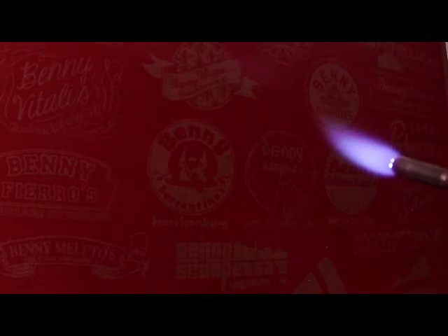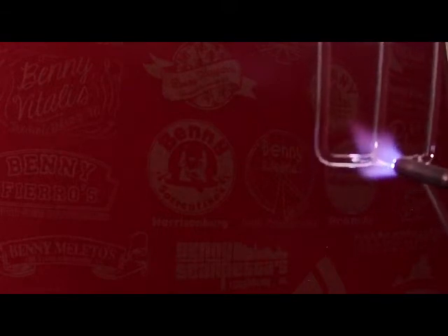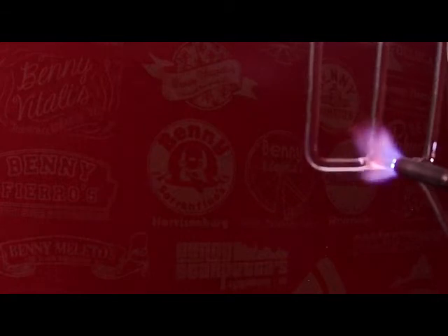In other words, if your goal is to have your piece of glass perfectly measured and fit the top and the bottom exactly on the inside of this little square, and then tack weld both of them, good luck to you, because that's going to be difficult to position. You could definitely do it, but I think it would be more trouble than it's worth, especially if you're beginning. And really why I'm showing this demo is, if you're a beginner and you want to get some really good practice on scientific glassblowing, making some small objects using a small torch like this and 3 millimeter borosilicate rod is an excellent way, I think, of learning these fundamentals.